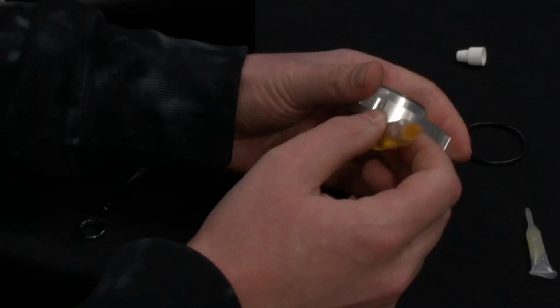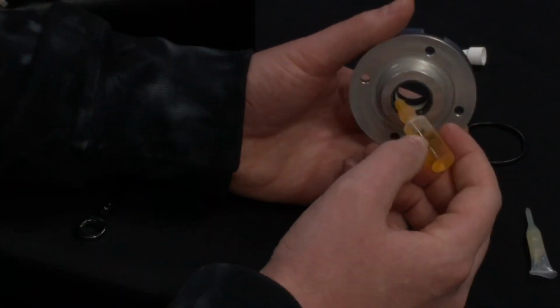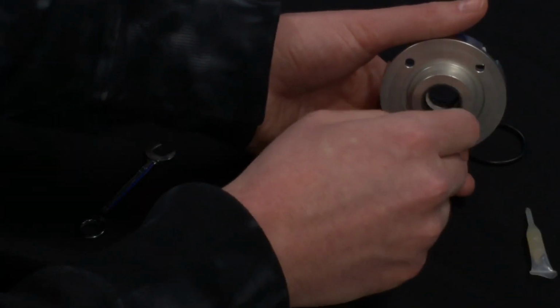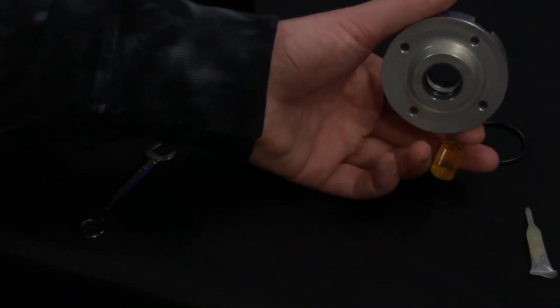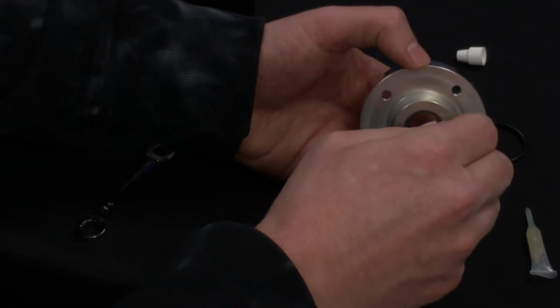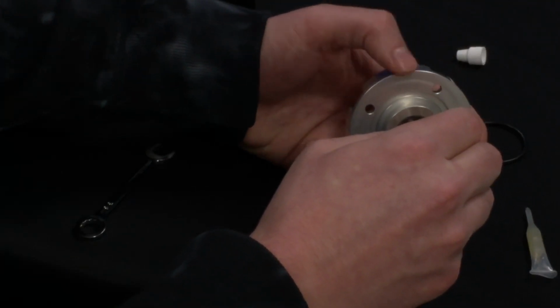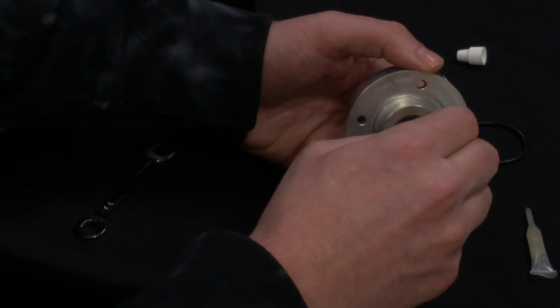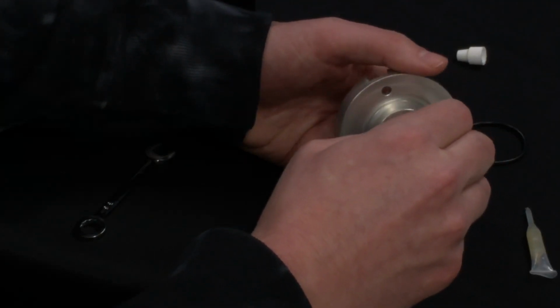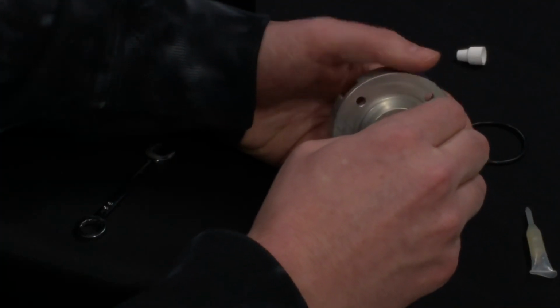And then we'll start with the oil in the felt shaft seal, which is this white ring. It feels like a sponge. And you are going to want to use this whole bottle. It should all sink in.